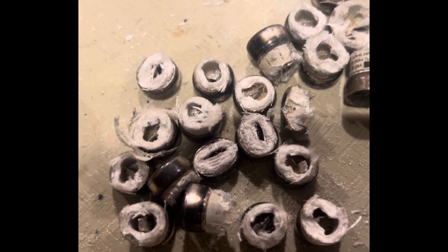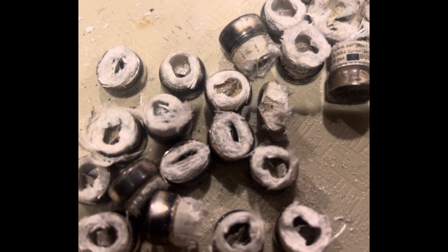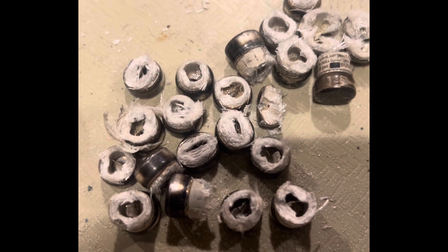With the little silver I got, I'm going to start up the silver cell. The copper cell is almost done. I had to add some sulfuric acid today to it — I'll go over that in the morning. But we'll see how much silver we can get out of these fuses.